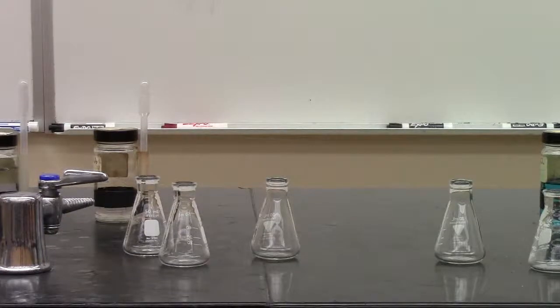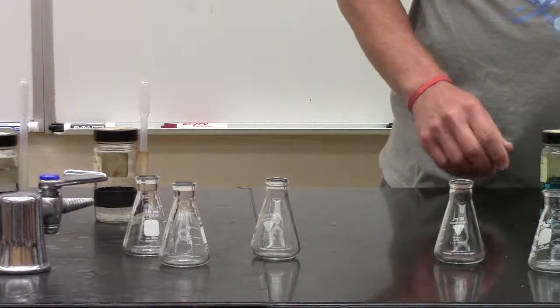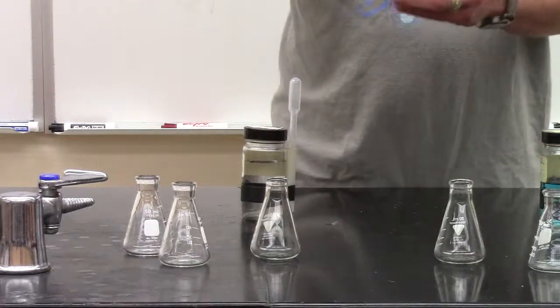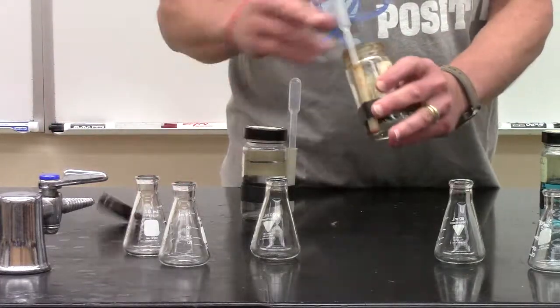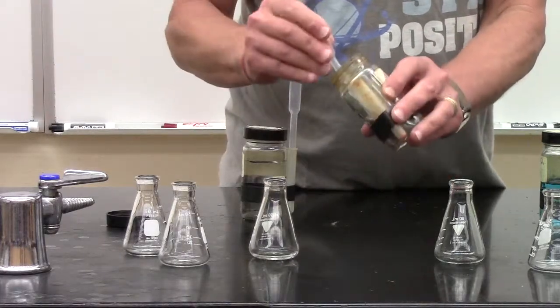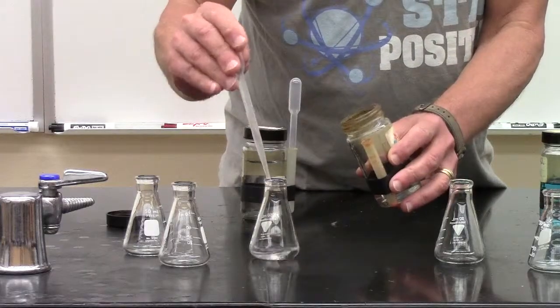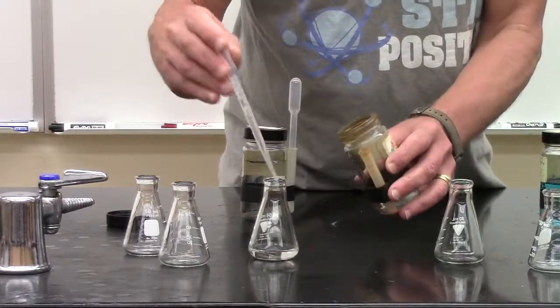So one of the things that got me into chemistry, besides explosions, was pretty colors. So let's do some pretty colors. Here is what we call ferric nitrate, or iron(III) nitrate. It's the iron(III) ion. Iron often has many different colors. And you can see this actual iron solution has no color at all.